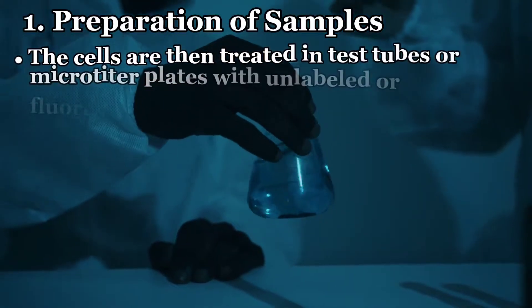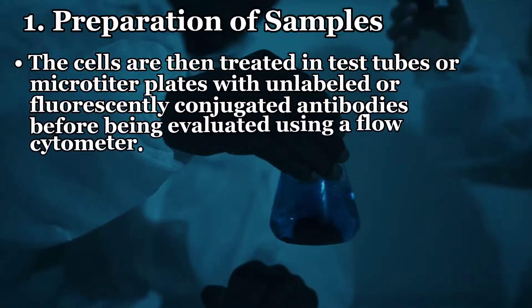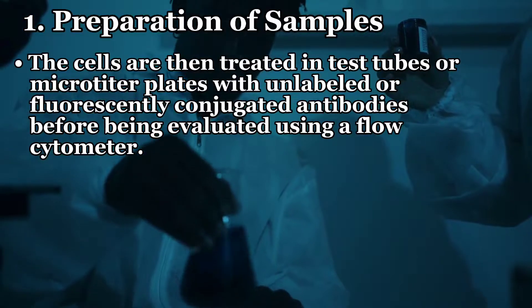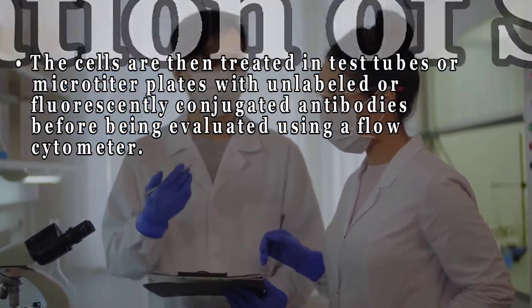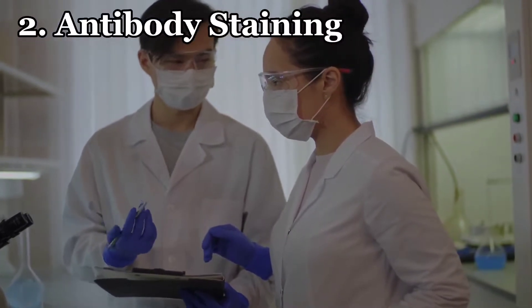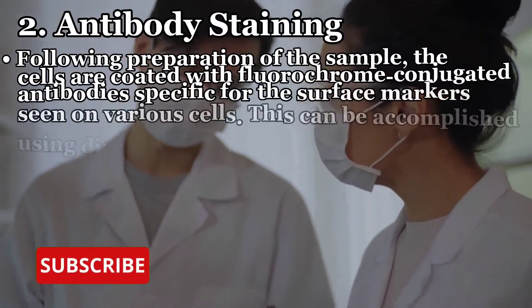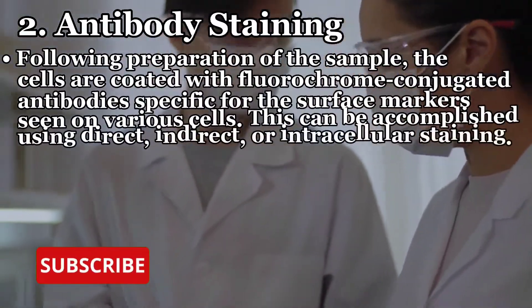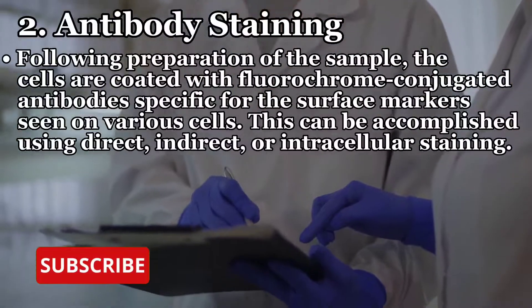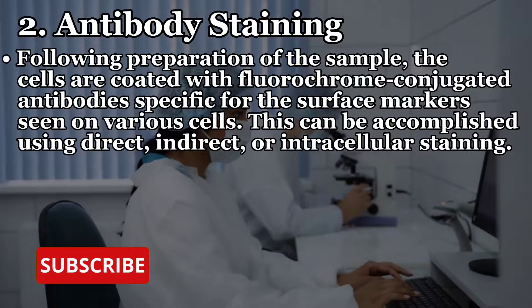The cells are then treated in test tubes or microtiter plates with unlabeled or fluorescently conjugated antibodies before being evaluated using a flow cytometer. Following preparation of the samples, the cells are coated with fluorochrome-conjugated antibodies specific for the surface marker. This can be accomplished using direct, indirect, or intracellular staining.